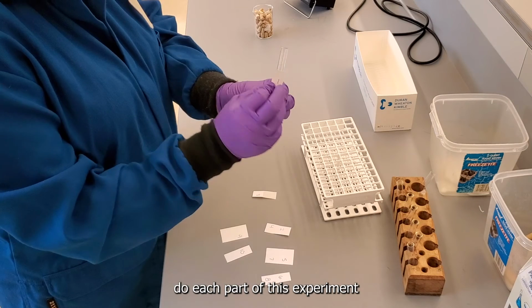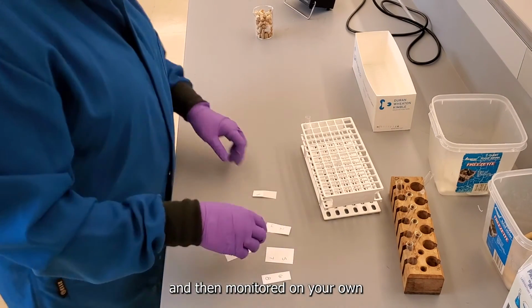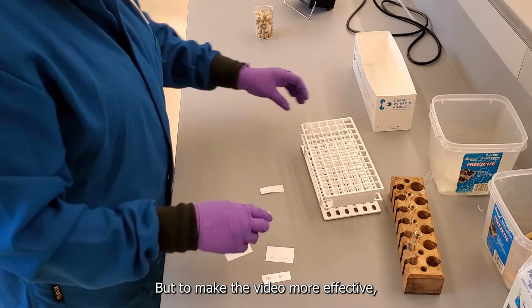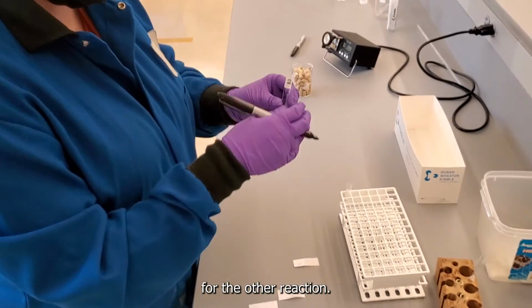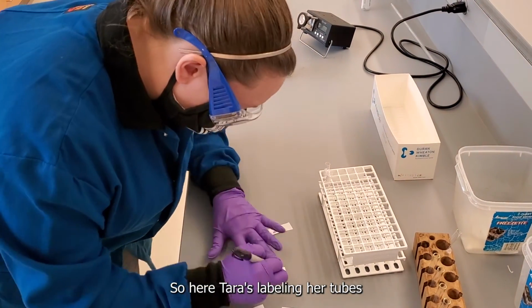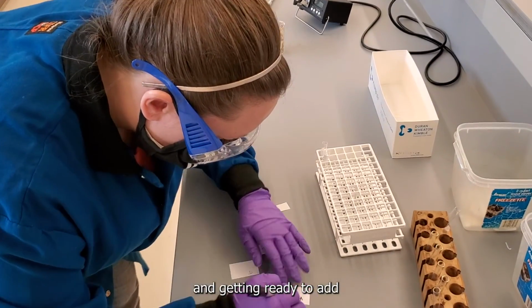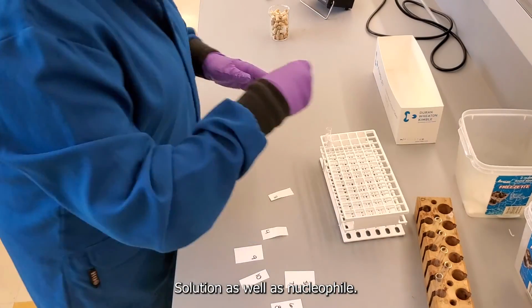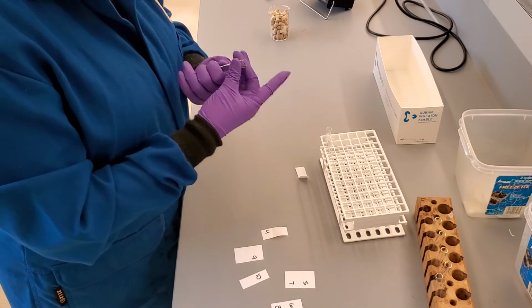Usually in lab, you and your partner could each do each part of this experiment and then monitor it on your own and transfer results. But to make the video more effective, we're just showing you how to set up again for the other reaction. So here, Tara's labeling her tubes and getting ready to add the corresponding solution as well as nucleophile.